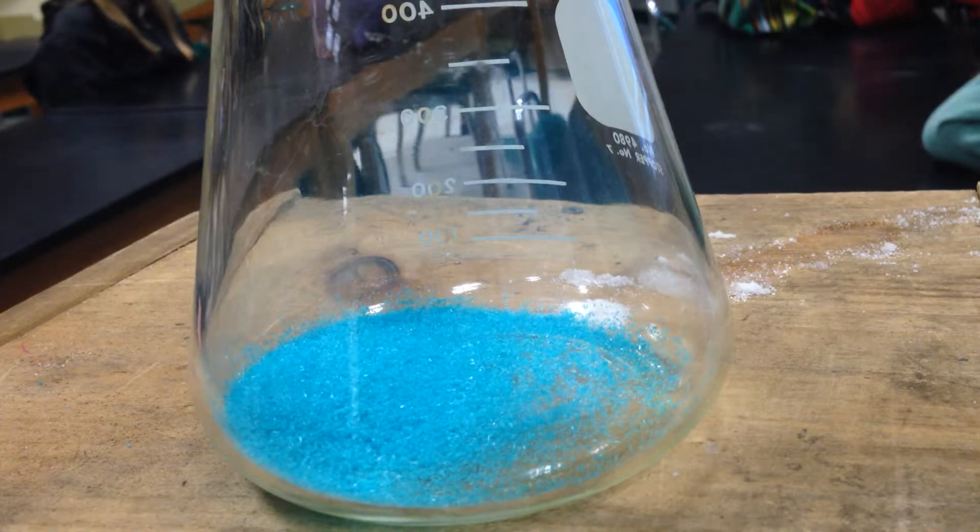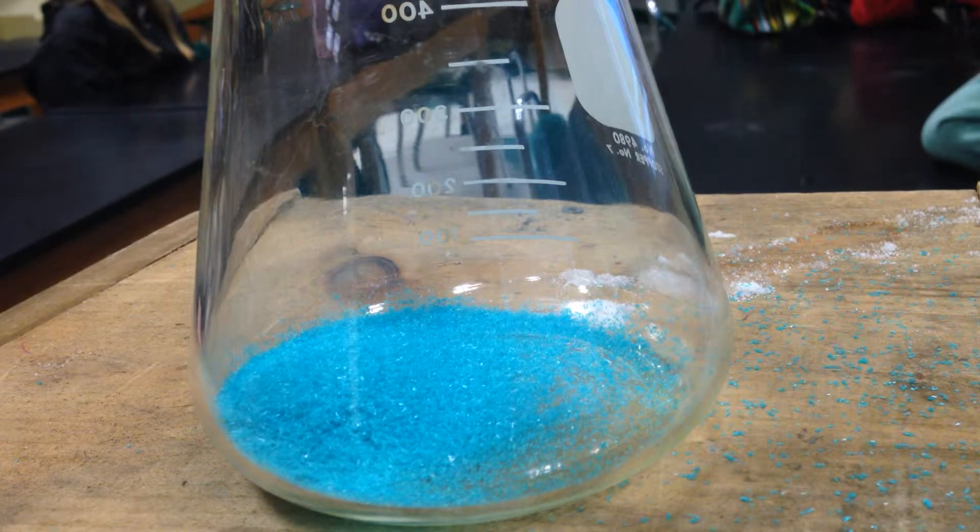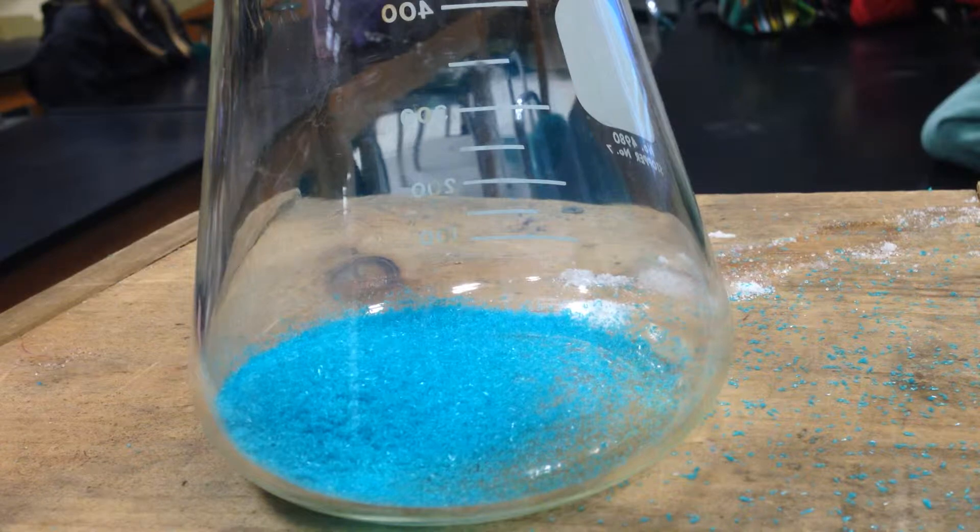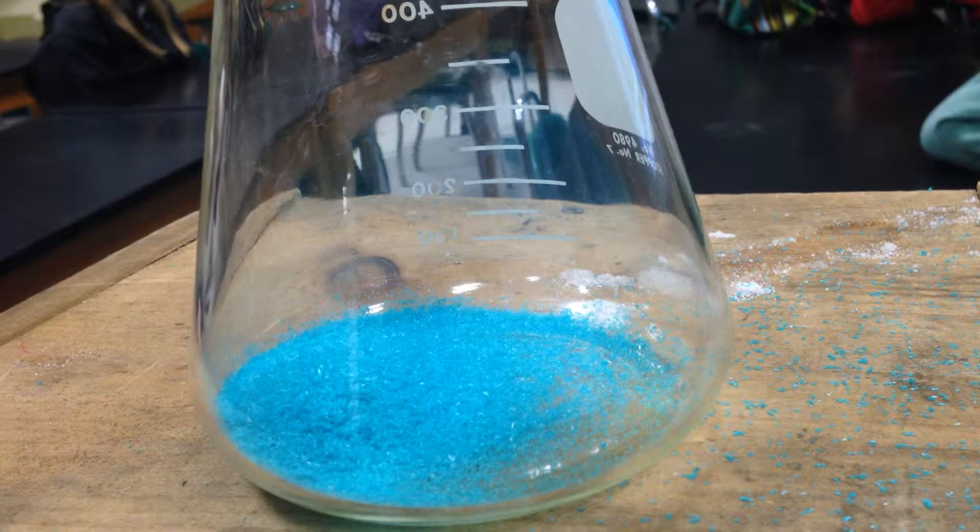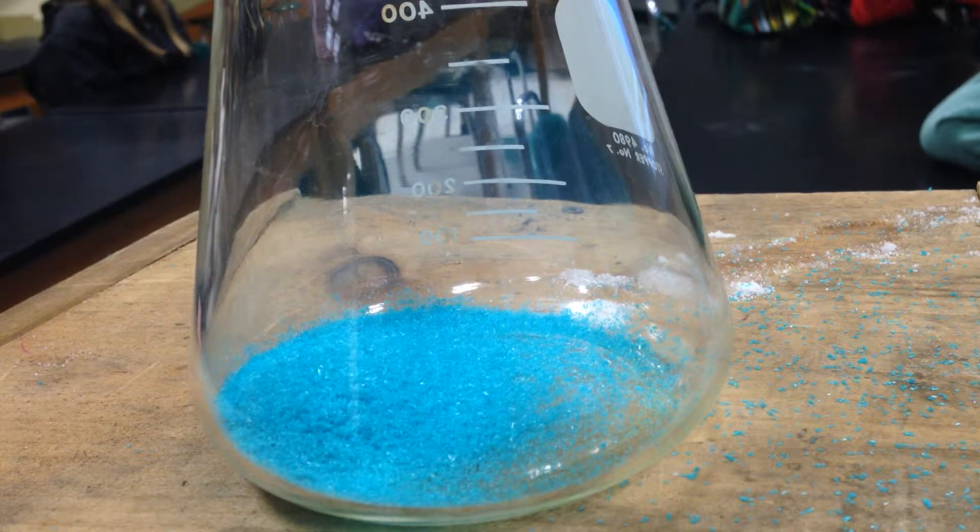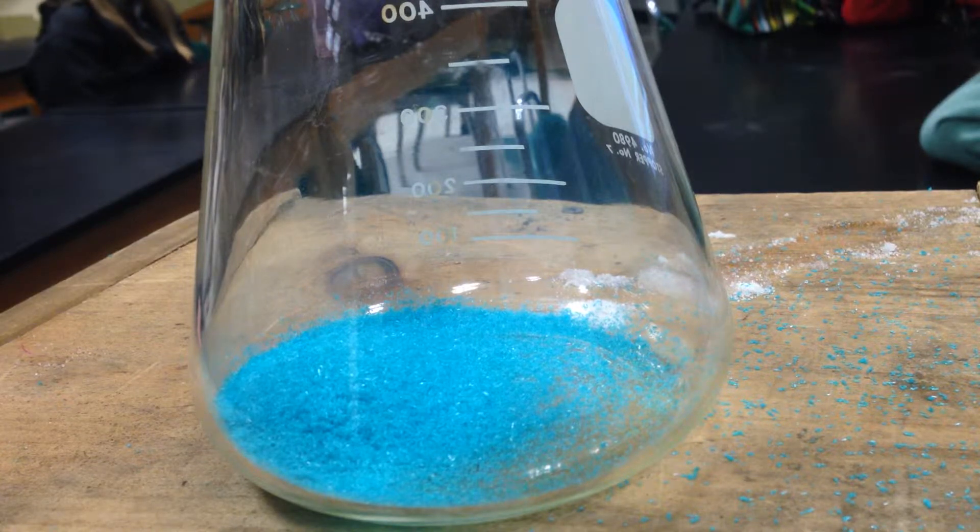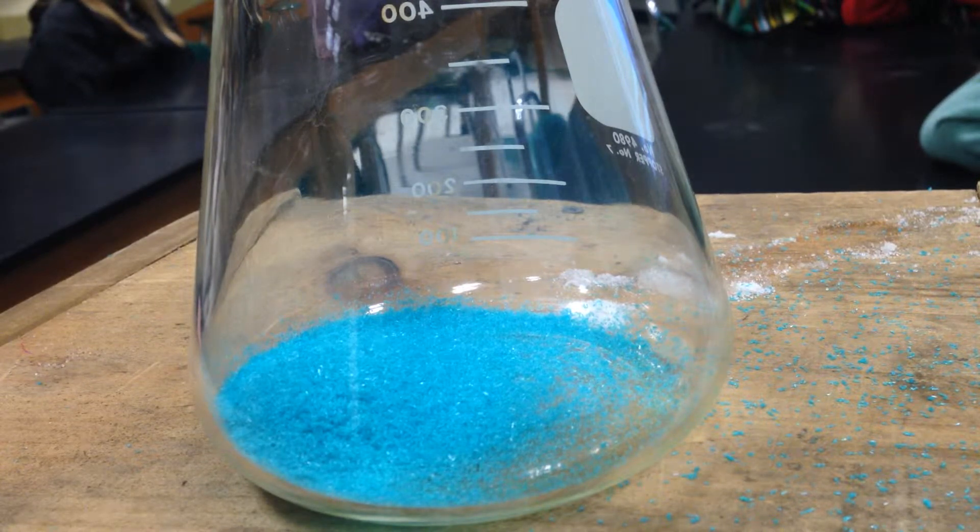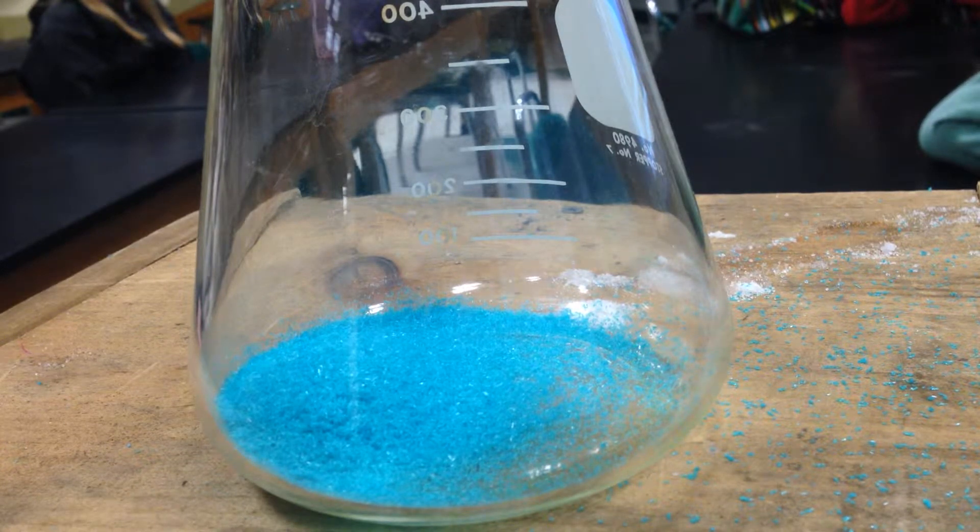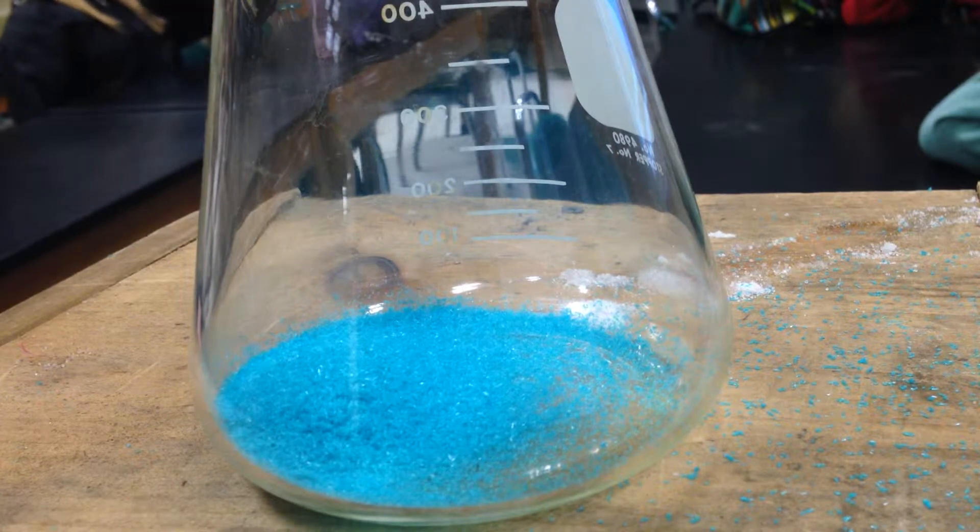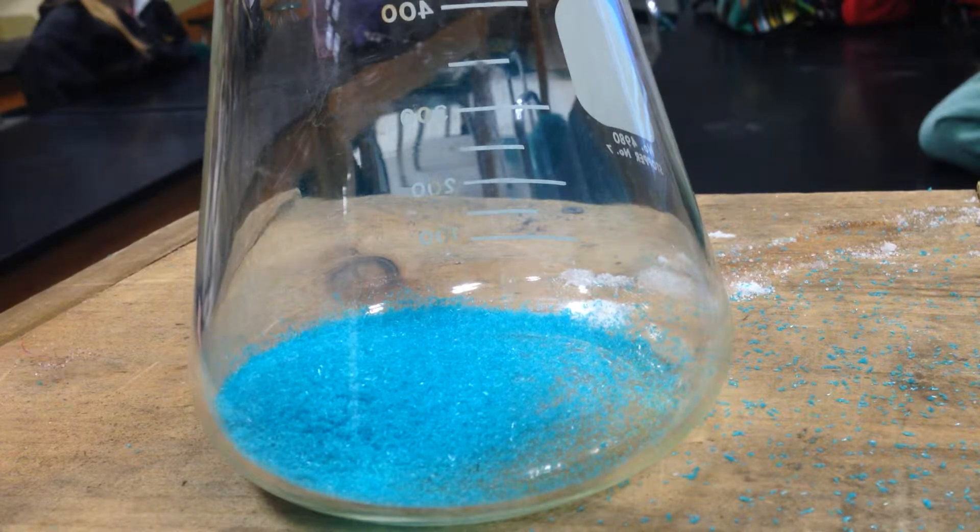Now I'll add some more here, and it's not perfect unless I spill some. Now, you can see that crystal already has a color. You remember last year, we used copper sulfate pentahydrate that had five waters, and that was a blue crystal. And you guys basically heated that crystal until it went all white. You kept massing the hydrate out until it became the anhydrate, and the color change, you lost the color, not because you lost the transitional element, you lost the ligand that was interacting and splitting the d's.